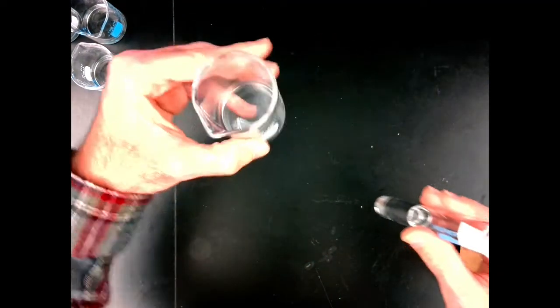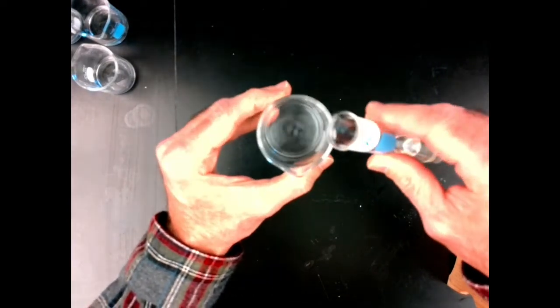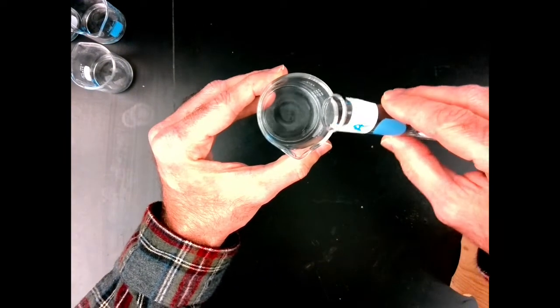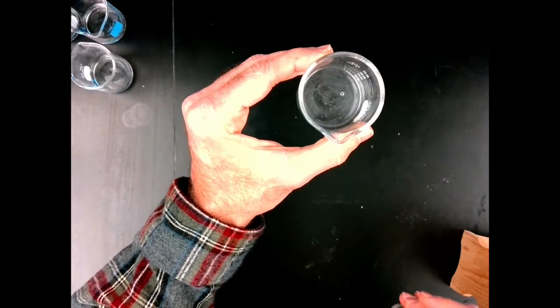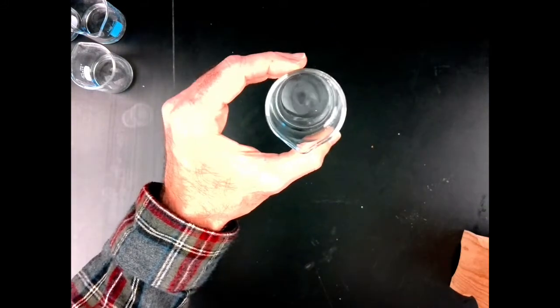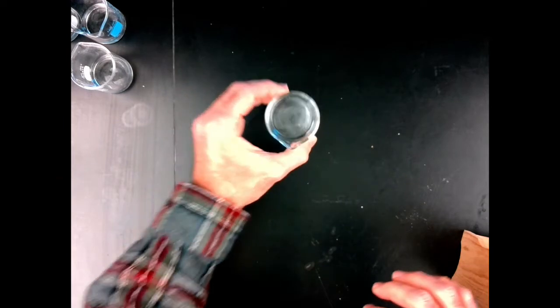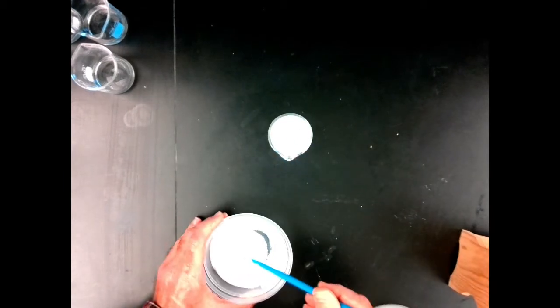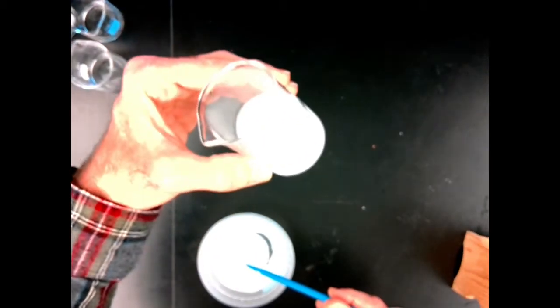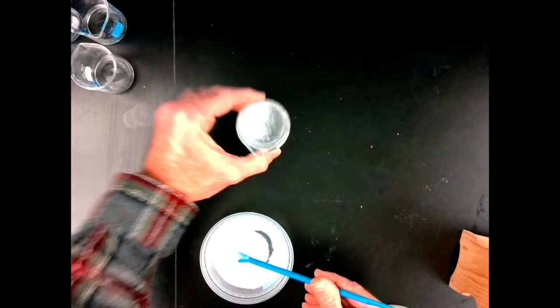Again, A was a clear solution. I'm going to pour some of this into the beaker here, and we'll see if we see any evidence of chemical change when we put substance A into an acid. I don't know if you could see that very well, but I'll put a little bit of solid A in there just in case that was not clear what that reaction was. So lots of bubbling and fizzing when A is reacted with an acid.